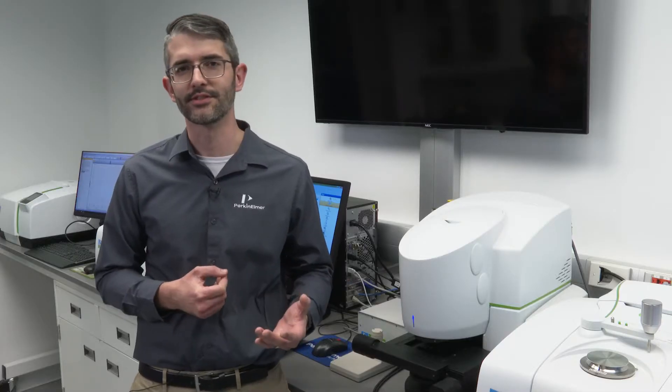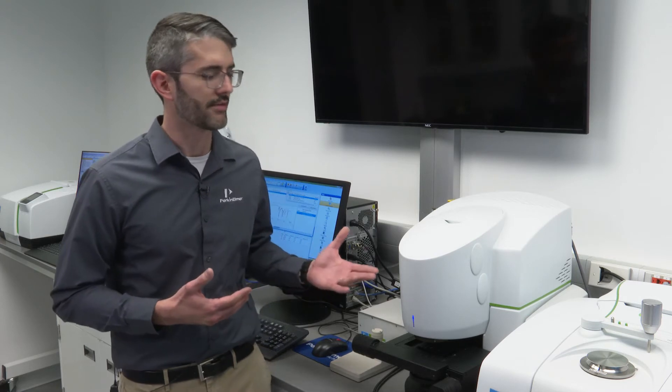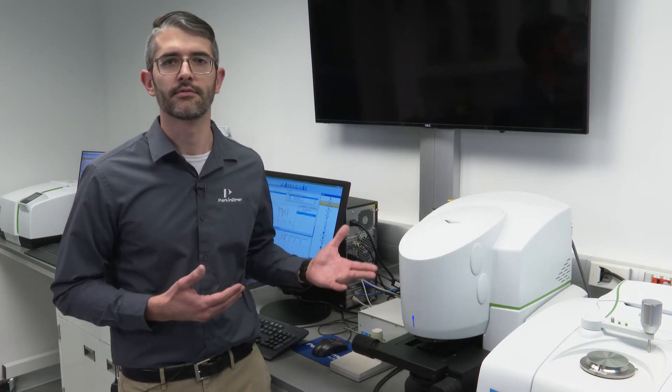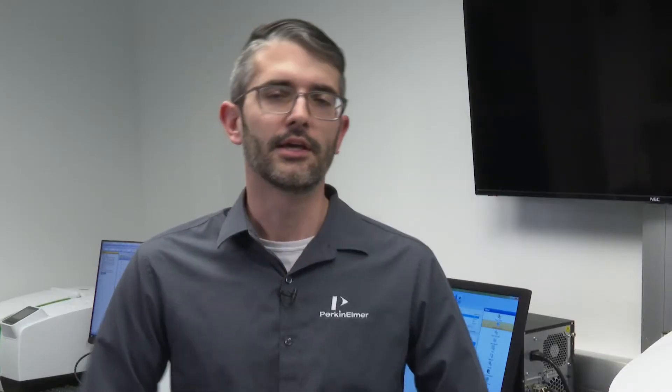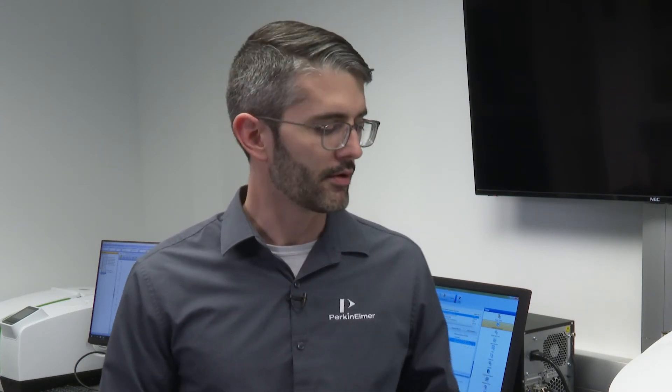In this instance, because of its small size, or in other instances where the region of interest on a sample is extremely small, infrared microscopy is often employed for the sake of the analysis. Infrared microscopes have the ability to focus the infrared beam and perform infrared measurements, such as those performed with a typical FTIR, except on a much smaller scale.